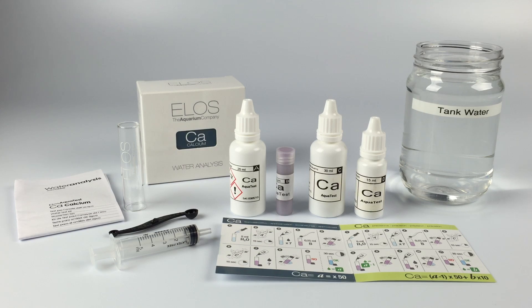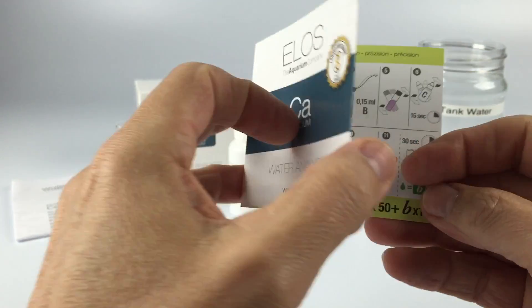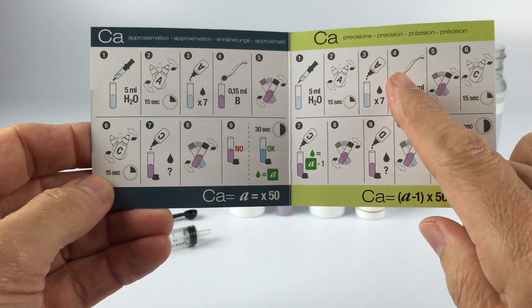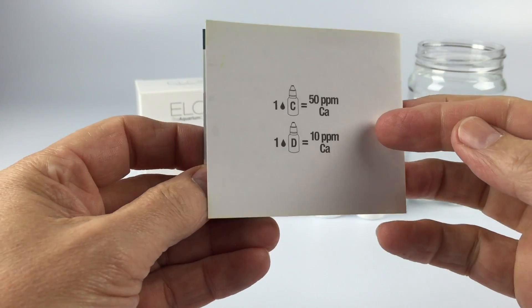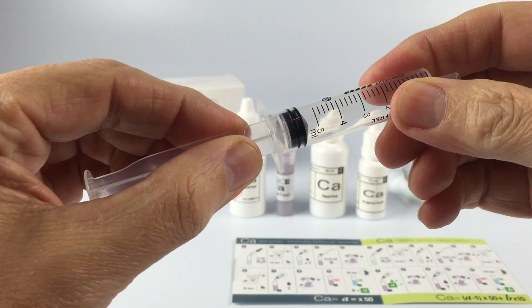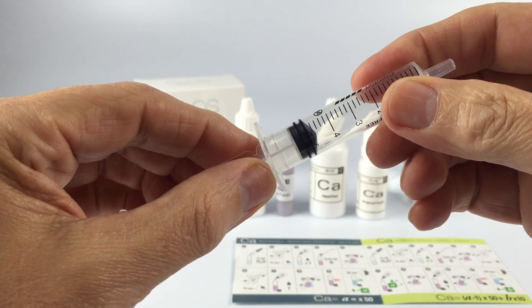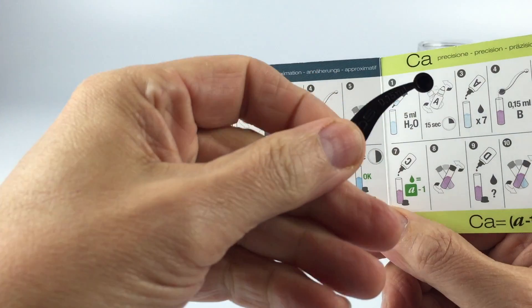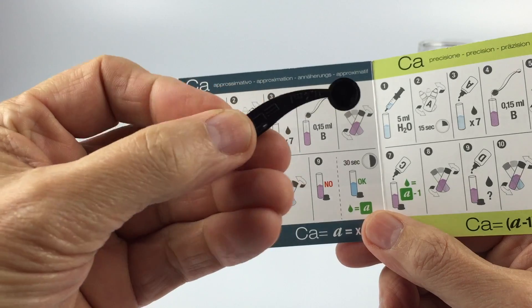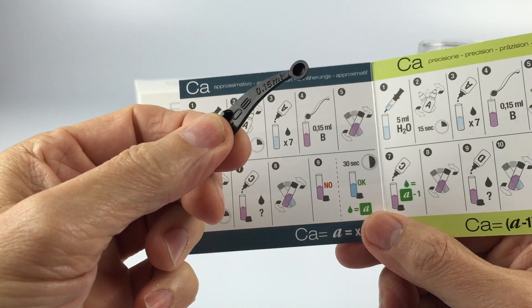This is how I perform the ELOS Calcium Test Kit. Refer to the instruction packet or this quick easy guide, either for approximate or precision testing. On the back you'll see the values of each corresponding bottle. You will be drawing up exactly 5ml of tank water for this test. Make sure the plunger lines up with the 5ml mark. Also notice this spoon — in the drawing it appears like you're going to use the larger scoop, but that's in fact the incorrect size. We're using the 0.15ml scoop.